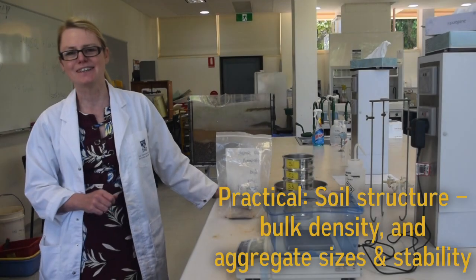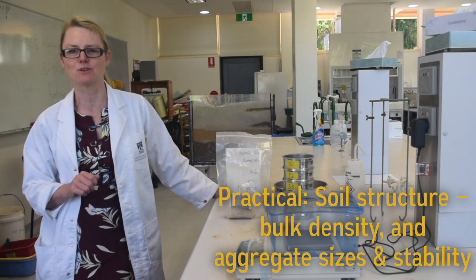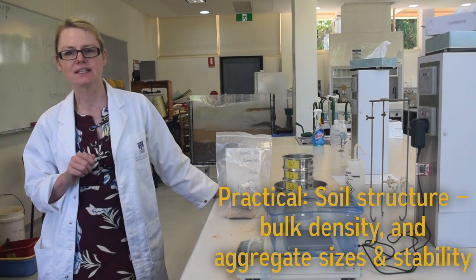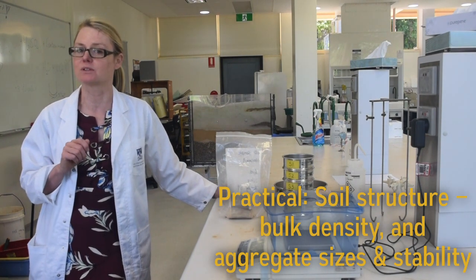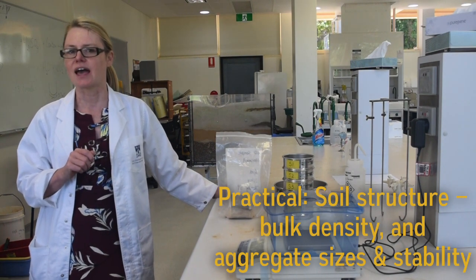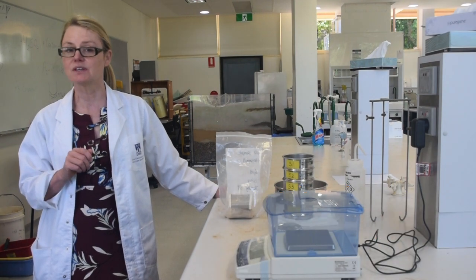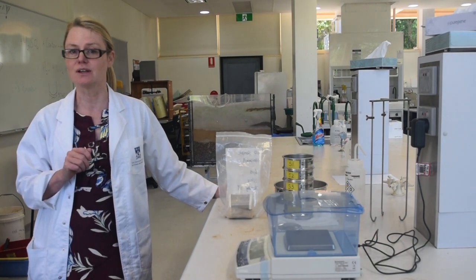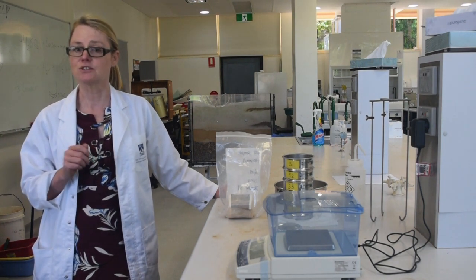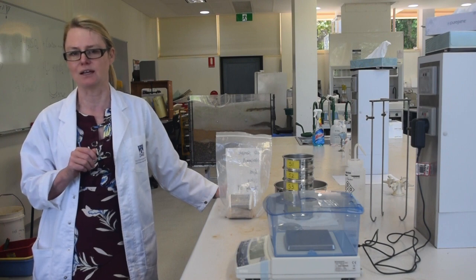Hi everyone. In this week's lab you'll be assessing various aspects of your soil's horizon structure. In particular, you're going to be determining its bulk density, measuring the distribution of the aggregates, and assessing how stable they are. Now if any of these terms are unfamiliar to you, please review your lab manual before you come to the lab, and you might want to consider looking at the glossary page listed on LMS.